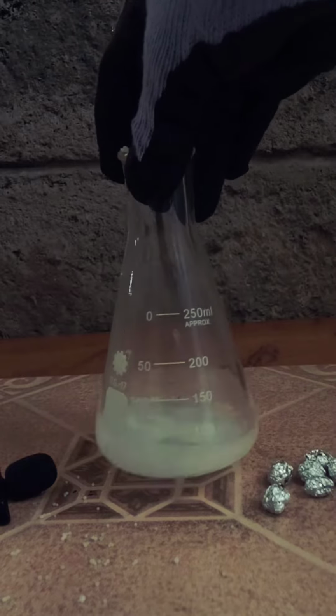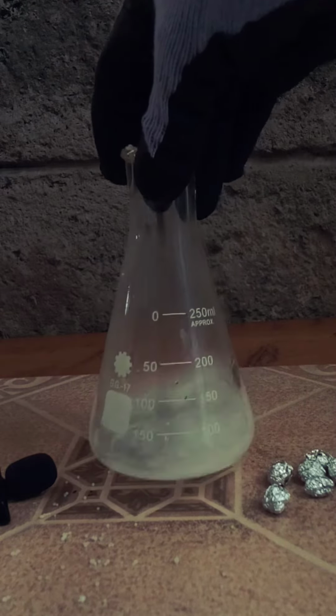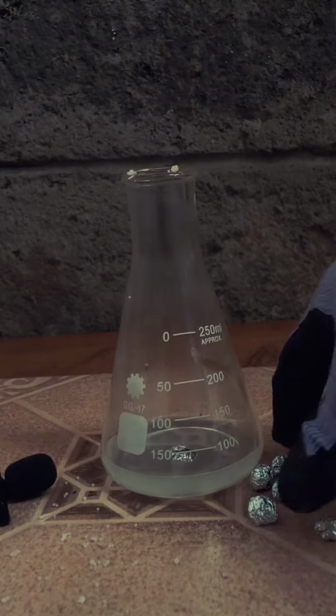In today's video, I'm going to show you how to make hydrogen gas from caustic soda and aluminum foil.